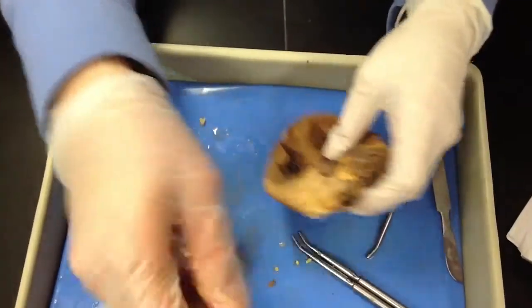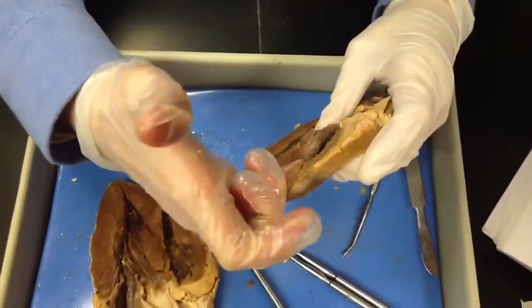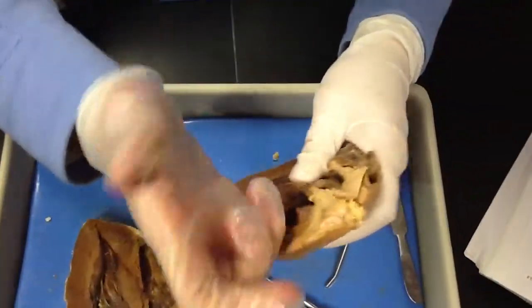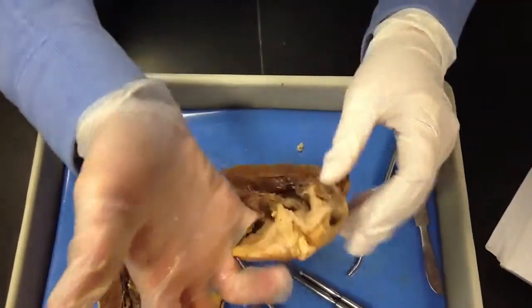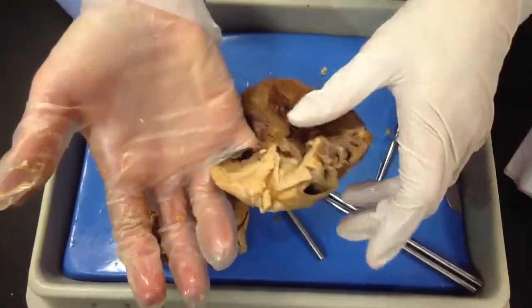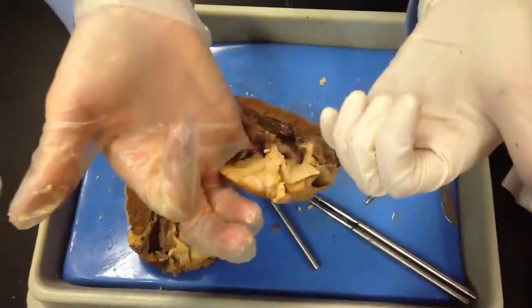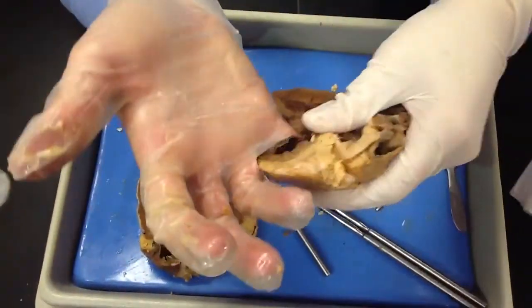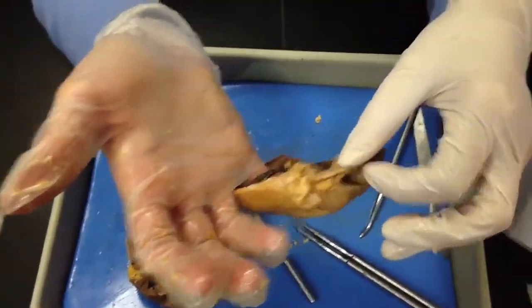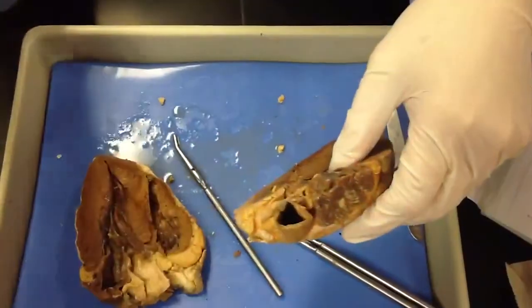And just how they have it cut, it's cut like this, a little bit weird, so you can kind of see where the valves were. So you're then going to take your finger and follow it through. What's it going to come out through? What's it pushing the blood out to? The pulmonary artery. Because remember, veins go to, arteries away. All right, so what valve is it passing through? Pulmonary semilunar valve. Yes. Now, it's going to go to the lungs.